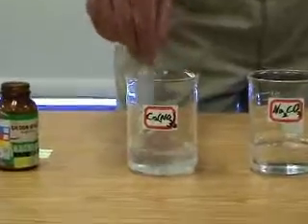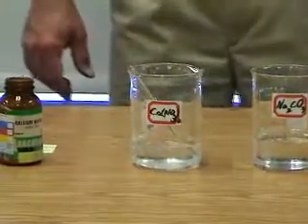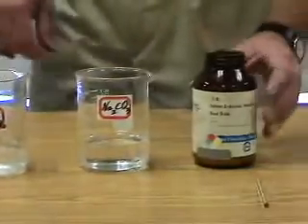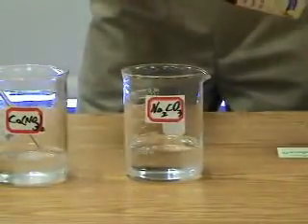Give that a stir. And on the other side, we have sodium carbonate. We will dissociate some of that in water as well.